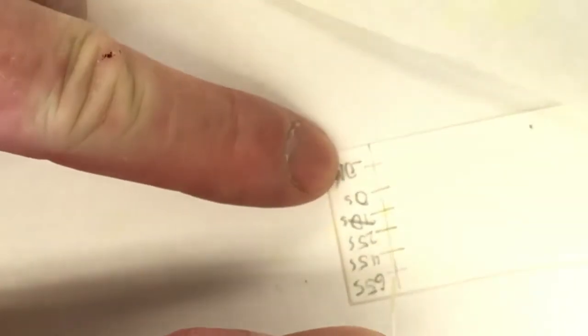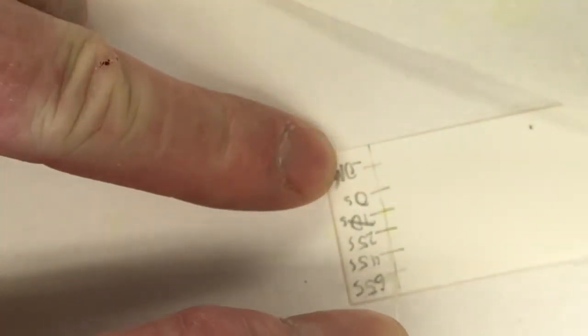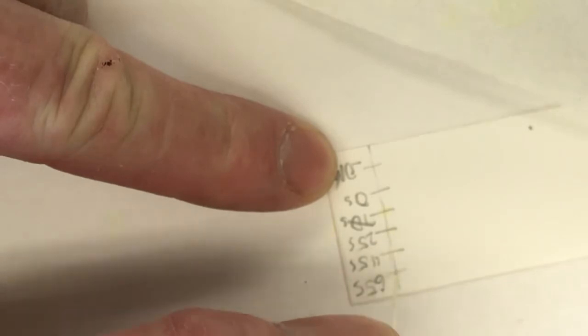Okay. And then I'll spot the 65-second area. Let me drain, drain, drain. Let me zoom in so you can see the spot. And when I spot it here, 1, 2, yeah, got it. That was at 2 minutes 38 seconds.